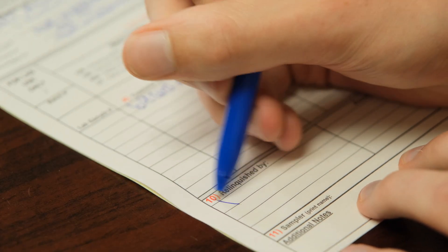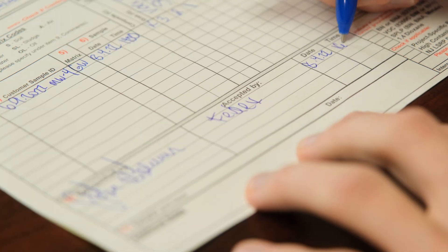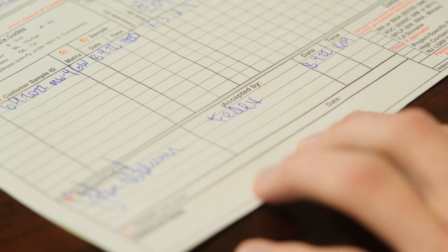Then there's another important part should your samples ever go missing — you want to make sure that you sign your name down there, put a date on it, and the time when you dropped it off, whether it be FedEx or the lab itself. Then you can leave a blank — whoever's picking it up from you, they'll sign it, date it, and send you a copy back if they're good about it.